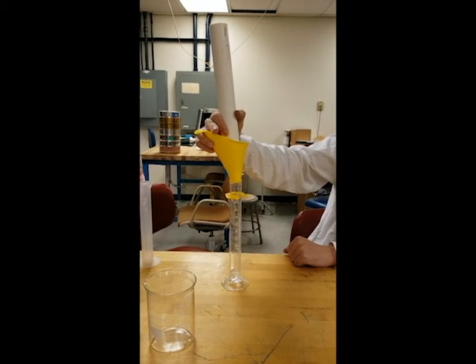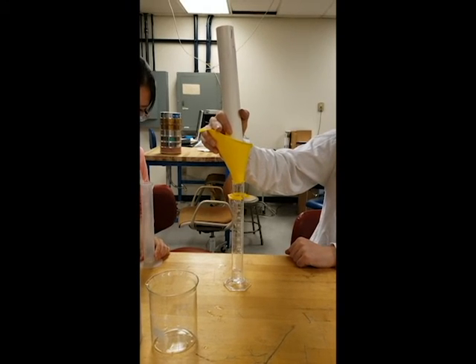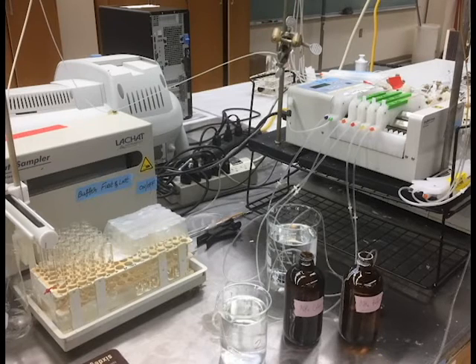In addition to the acetaminophen, we ran wastewater through a fresh 2-inch bed in the same fashion. Samples of the filtered solution were collected and the concentrations were measured using UV spectroscopy. The results we found were that the activated carbon acceptably filtered the pharmaceutical to a very low concentration. However, it quickly became saturated, which means there was not enough carbon in the packed bed for sustained use.